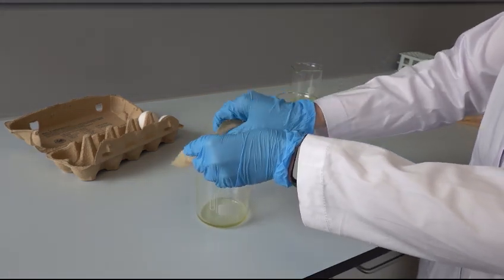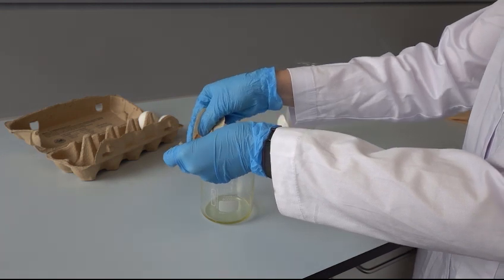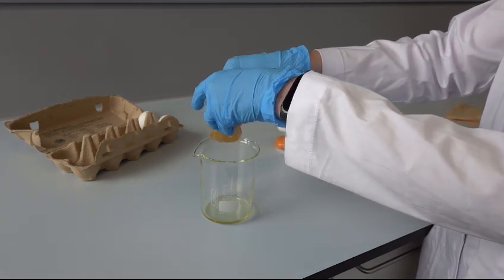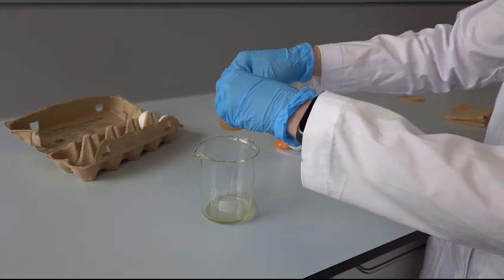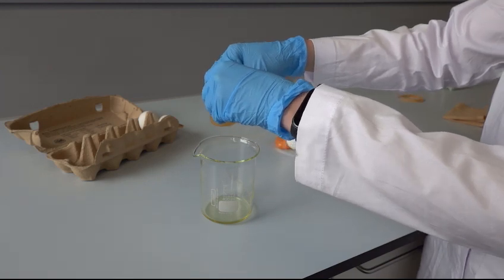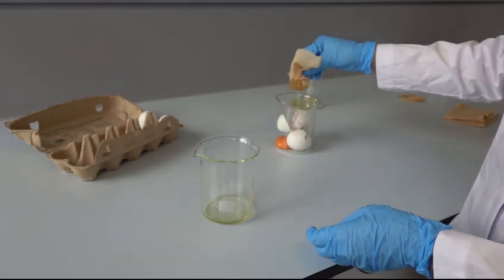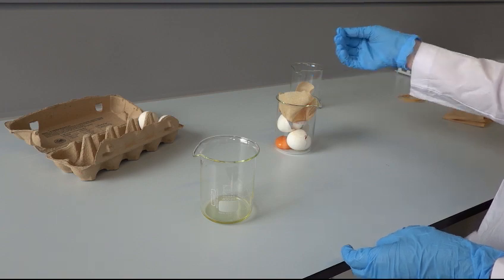Take the cheese cloth together. Try to form a small bag and wipe off the liquid which is covered on the outside of the bag at the edge of the beaker like is shown in the video. Discard the cheese cloth.